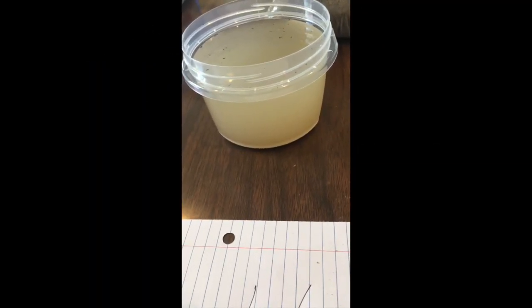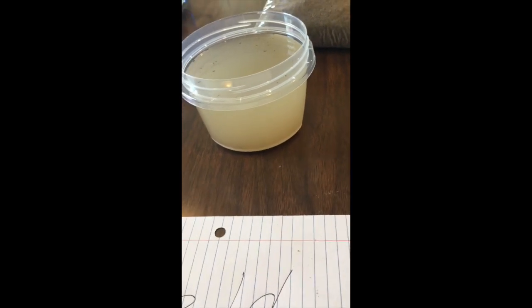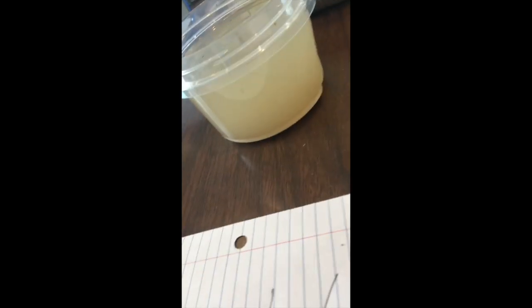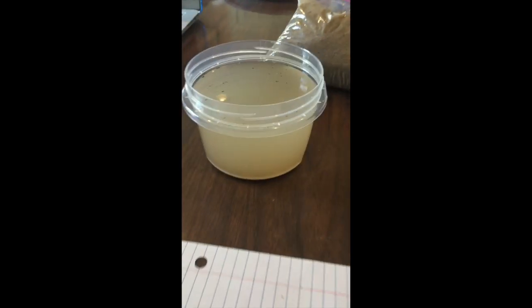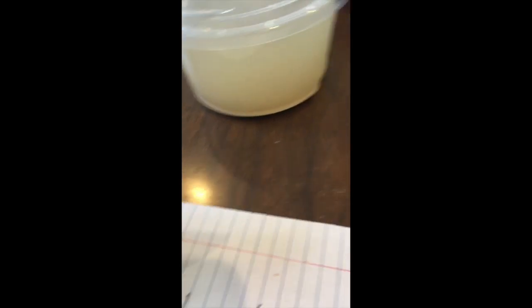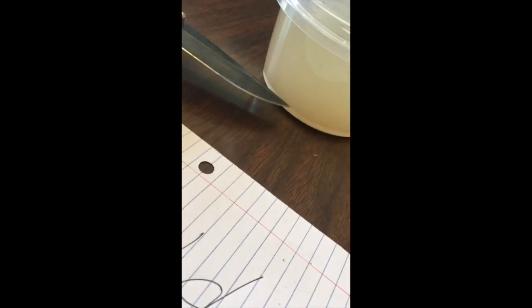As the instruction said, allow the sediment to settle in the transparent cups for 10 to 15 minutes. I allowed it for 14 minutes, and it's still settling as of right now. You can still tell the water's extremely murky on both of them. Right here on the field soil, you can see some of the other stuff floating on the top. I'm going to use my knife blade to pinpoint it because my fingers are fat. Right about that little white line on the bowl itself, you can see where a lot of the soil that came out into the water is settling.